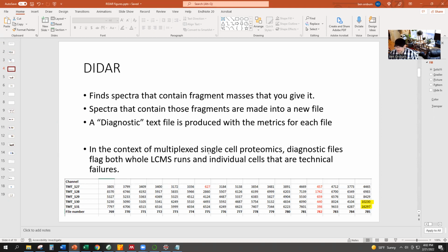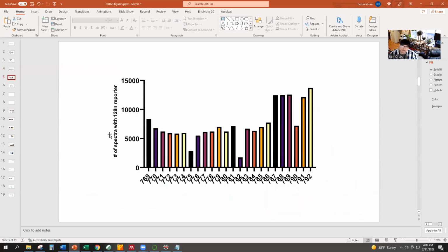So DIDAR can give you these really fast metrics in these little text files that it generates, that can tell you, as you're going through optimization, what you're doing right, what you're doing wrong. We found this really helpful as we could just generate this text file really fast to know if that last run was okay and if we should try that again during optimization. We can also take these diagnostic outputs and graph them in things like GraphPad. And here you can see those same two failures. The 775, 128N was bad, and so was the 128N in 782. But in 782, it was all of them, right?